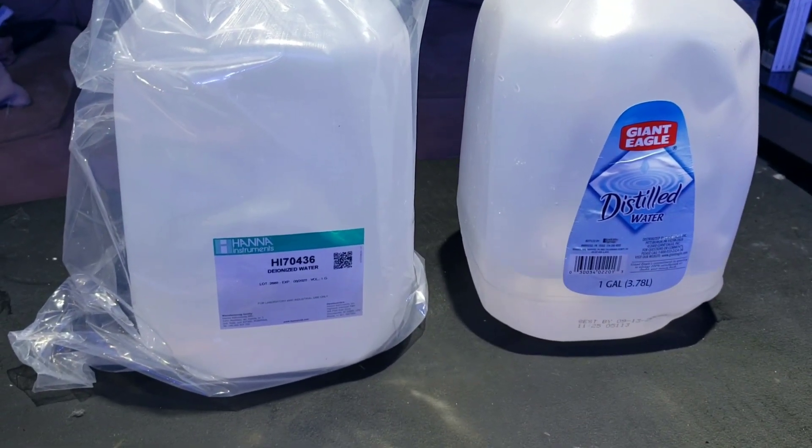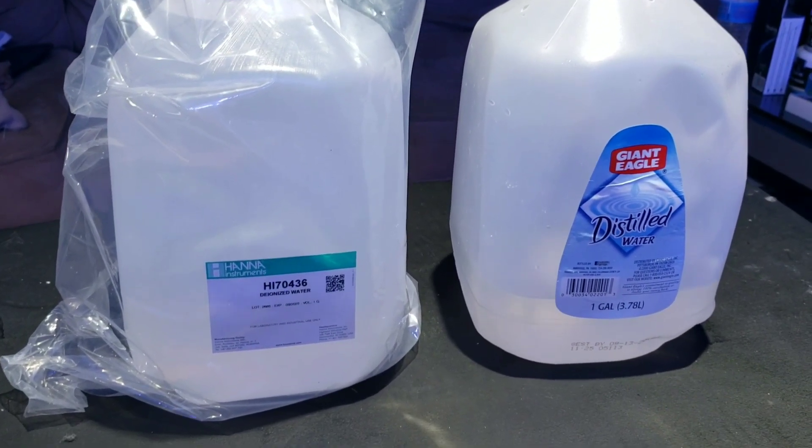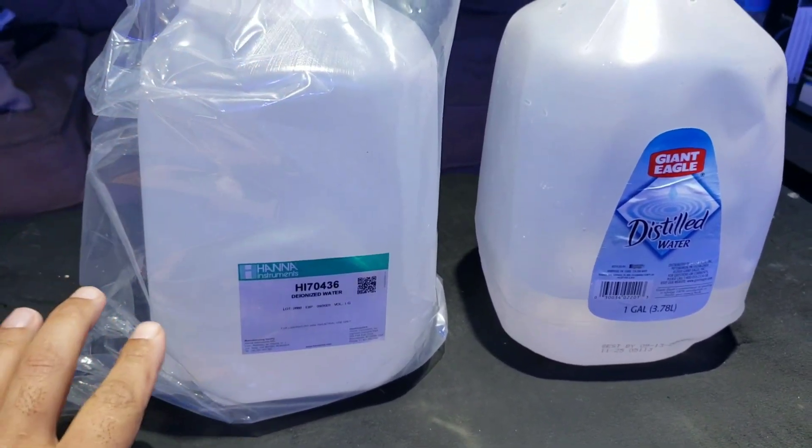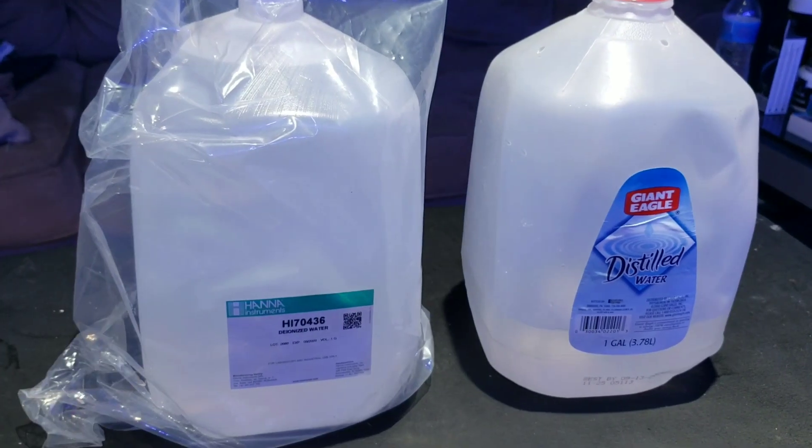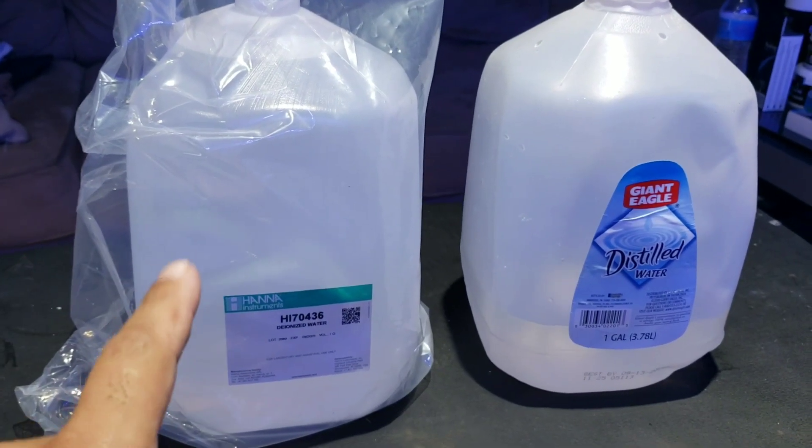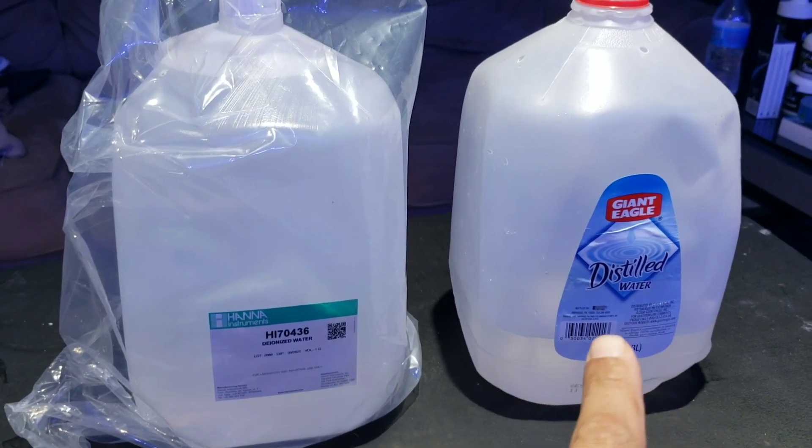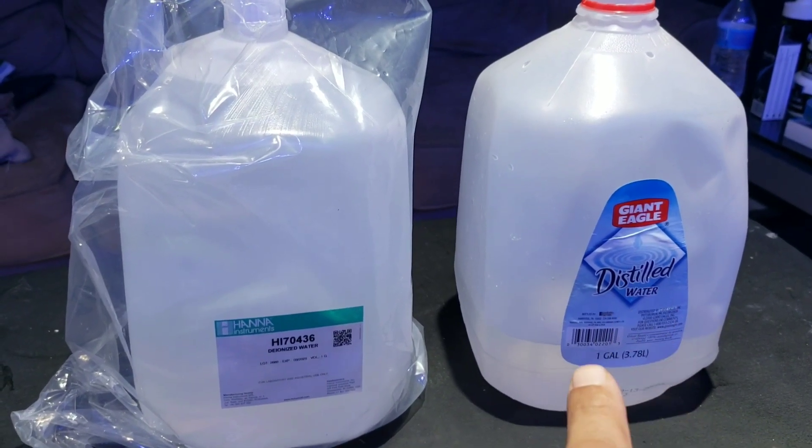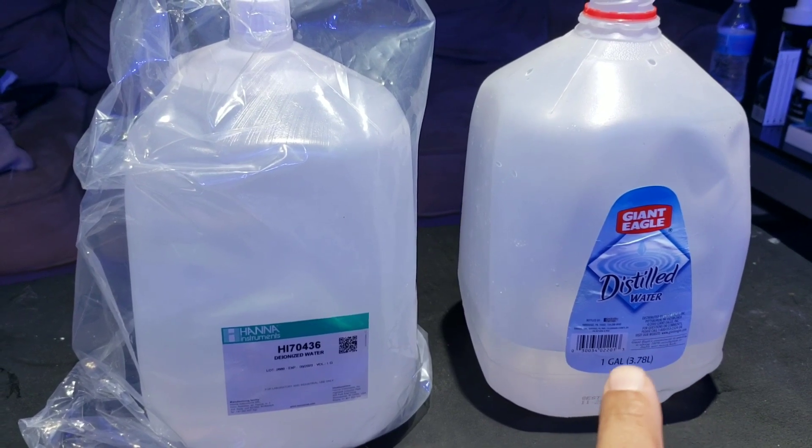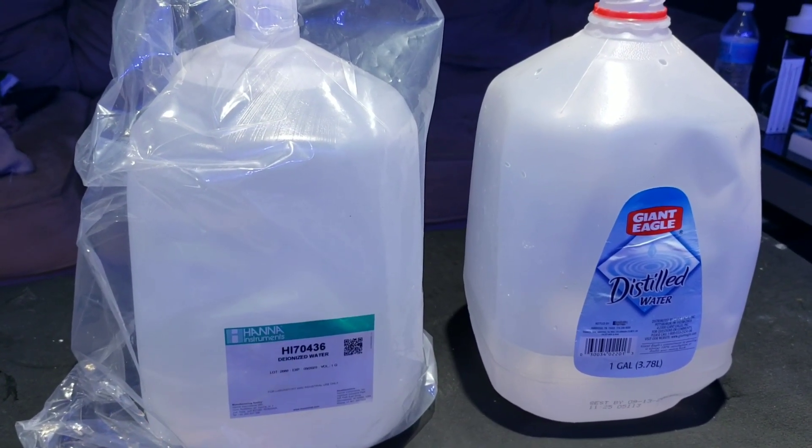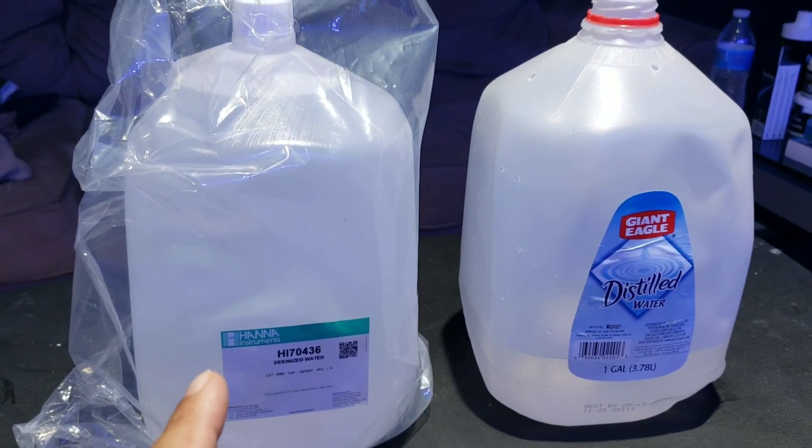Real quick guys, I do want to go over something. Now Hanna has their own water as well. I'm just going to tell you straight up, you don't have to buy their water. You can go to your local store and pick up a gallon of distilled water and it's going to cost you under a dollar versus theirs. Just saying, got to keep it real, you don't need theirs.